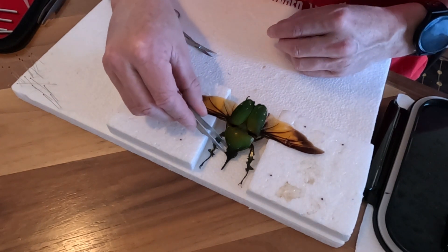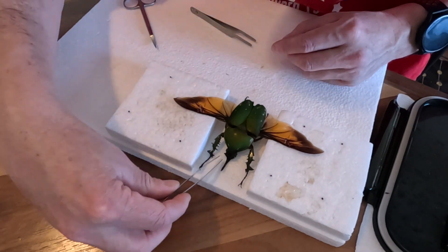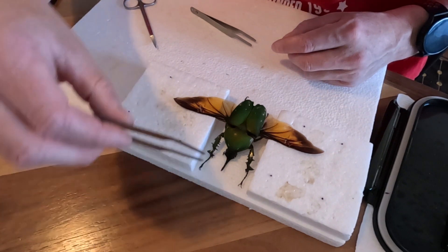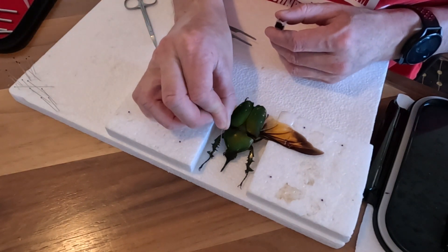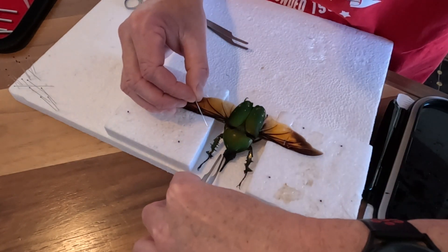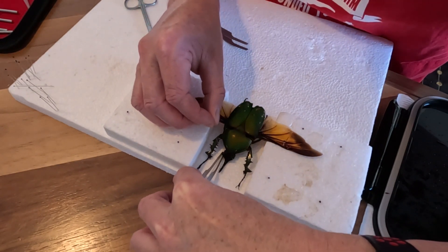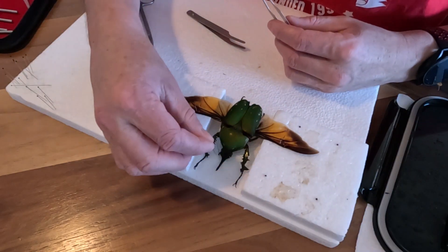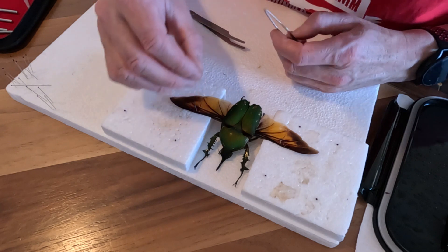Try and get these antennas out — they were pretty tricky. It's easier with a pin. Put one in there, one in there, just on the other side.